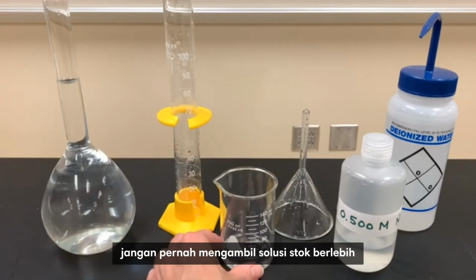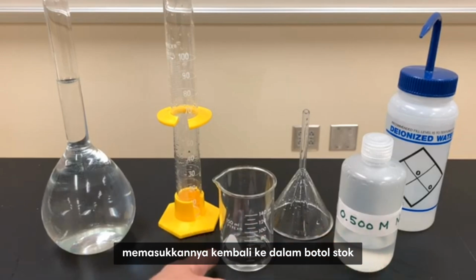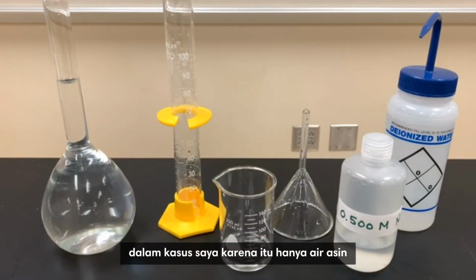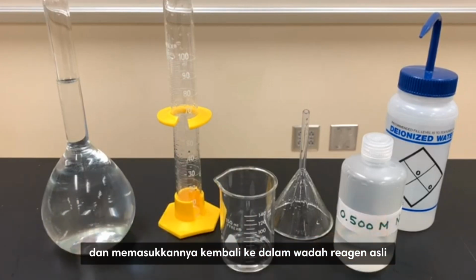Last but not least, do not ever take any excess stock solution and put it back into the stock bottle. Either dump it down the drain, in my case, because it's just salt water, or put it in a waste container. But never ever take your excess stock solution and put it back in the original reagent container.